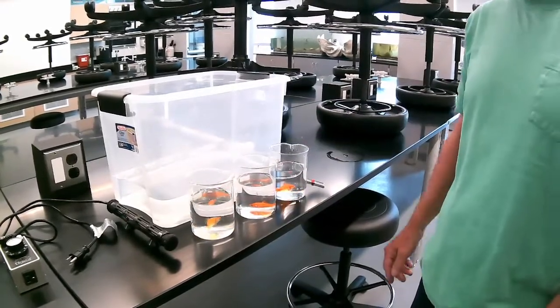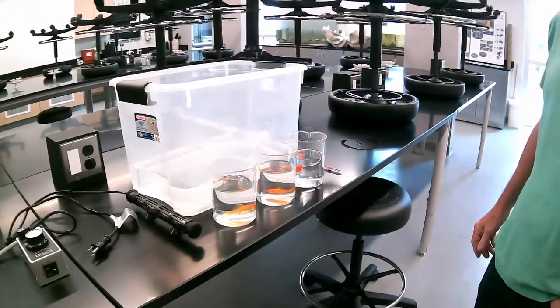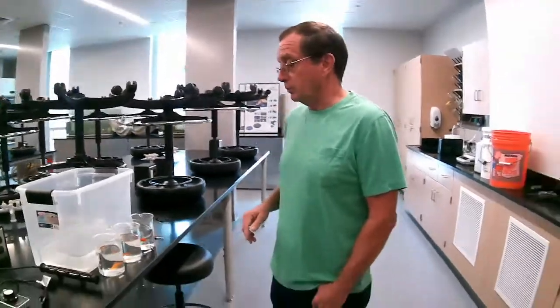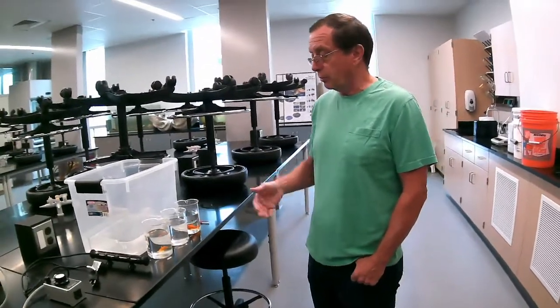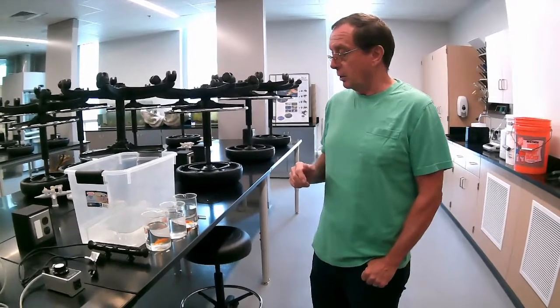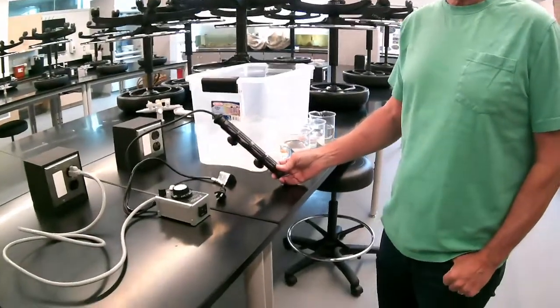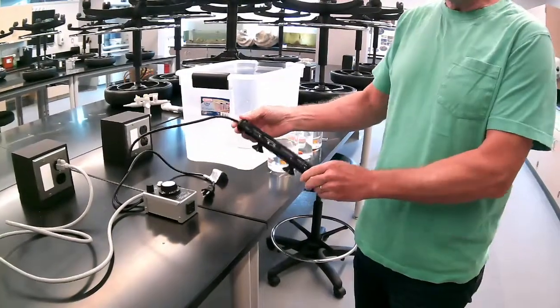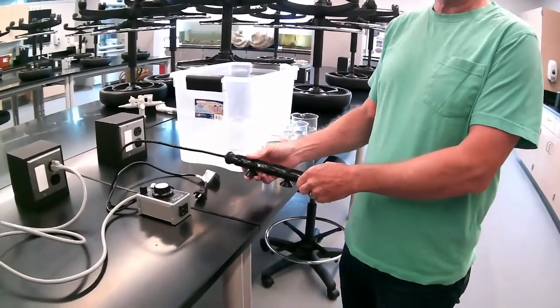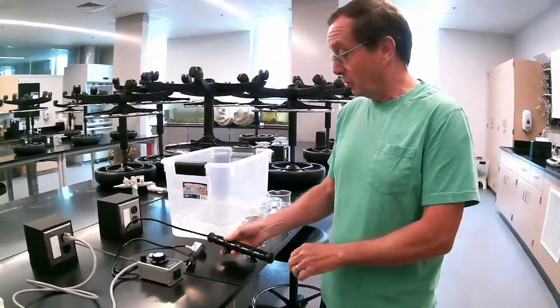We're going to run 3 at a time so that we get replicates of 3 every time we run a trial with this. These fish have all been acclimated, as I know, to room temperature. So that's where we start, and we will increase the temperature slowly until they lose equilibrium. The second thing that we have here is this is a 300-watt titanium heater. The heater heats extremely fast because you can see there's a relatively small amount of water here. So 300 watts is going to cause the temperature to move really, really quickly. And so we want to avoid that.